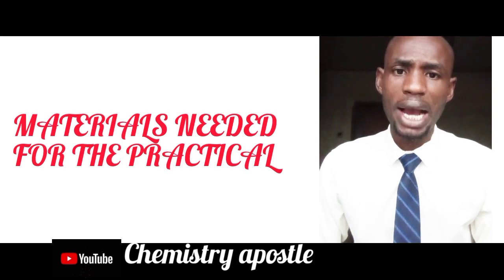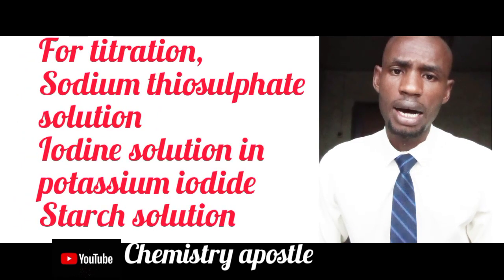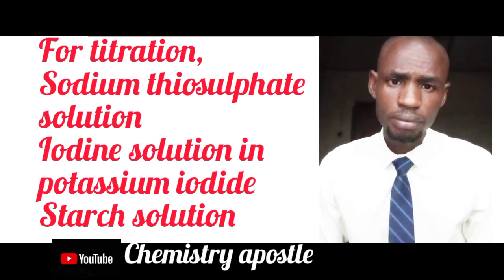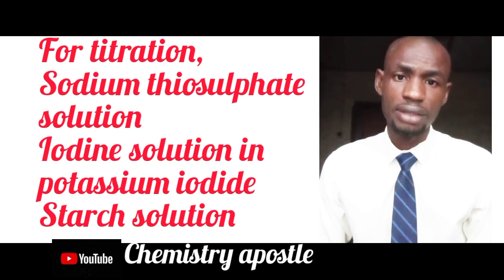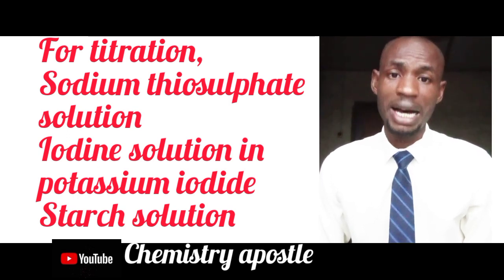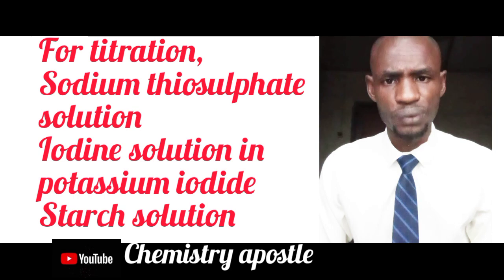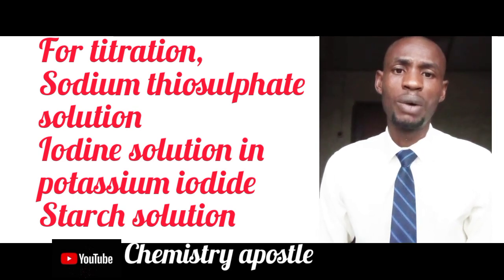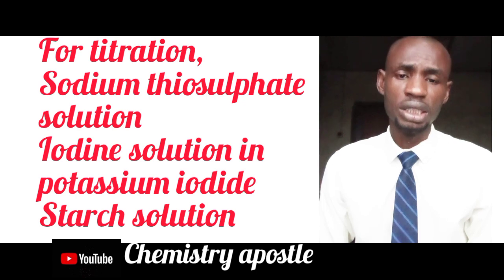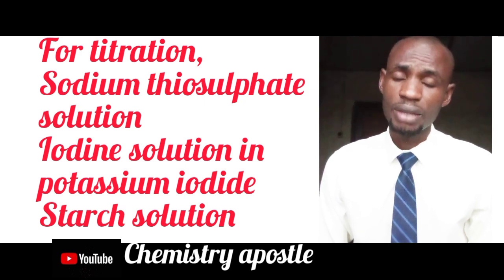For 2022 WAEC Practical, you are going to need sodium thiosulfate, iodine solution — that is iodine crystal dissolved in potassium iodide — and starch as indicator. Sodium thiosulfate will represent our acid because we are going to fill the burette with sodium thiosulfate. We are going to pipette the iodine solution dissolved in potassium iodide, and that will represent our base.